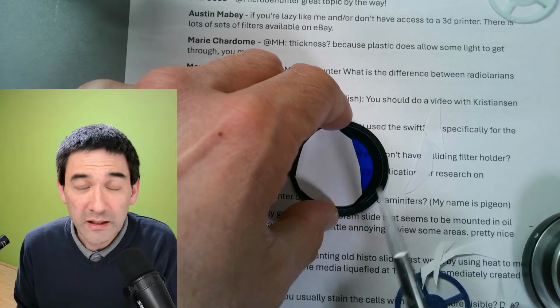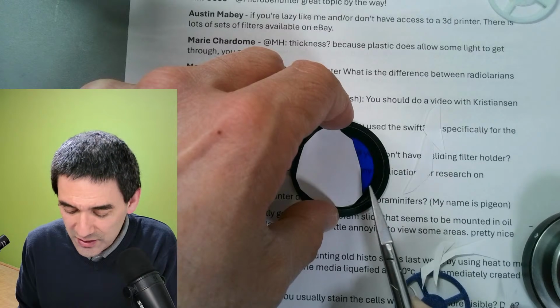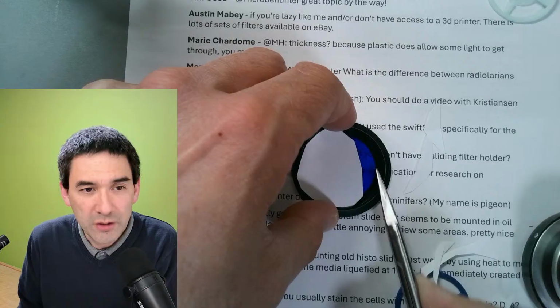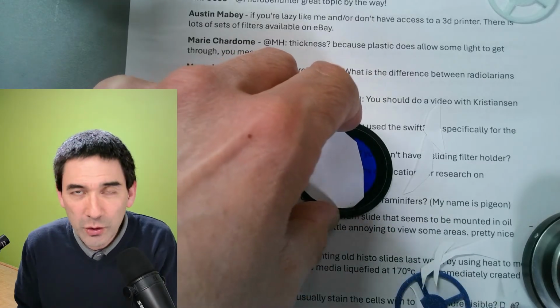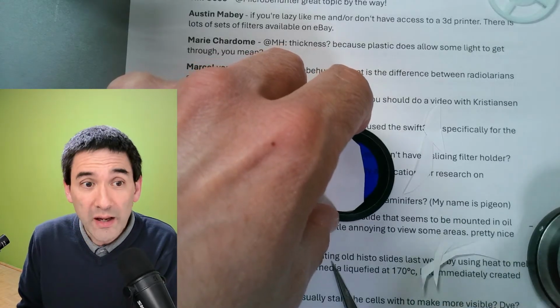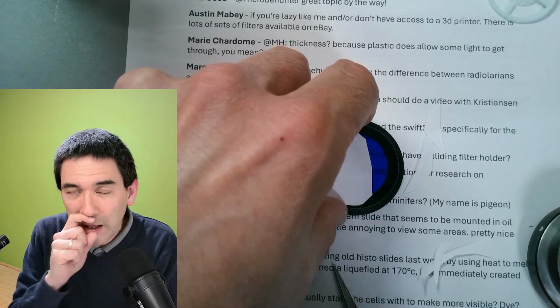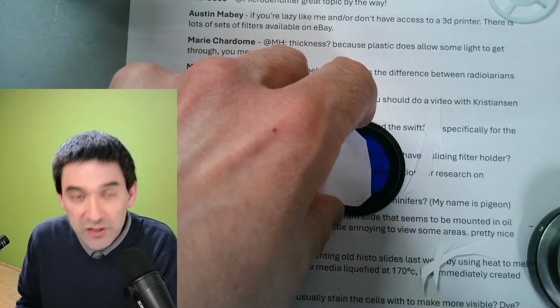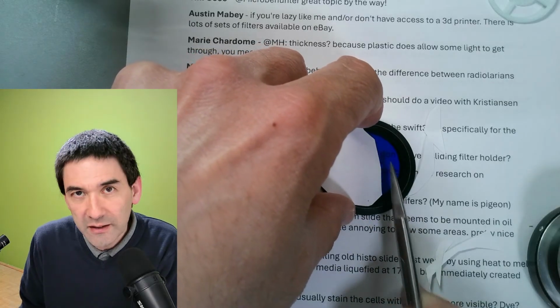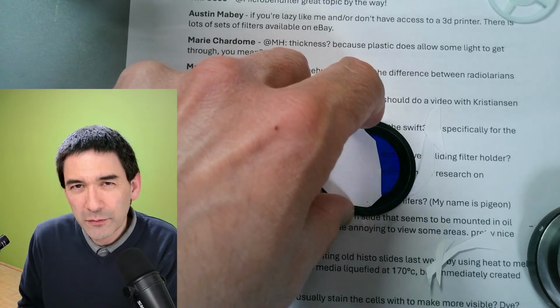If you do some research online, there are so many different variations of this, essentially how big it should be and the shape. However, there is one recommendation that I have. By the way, you can try the same thing also with a swing out filter holder. It doesn't matter, okay? There was one interesting thing that I once read. Otherwise you only have light coming from the side, and you also want to have a little bit of general light.